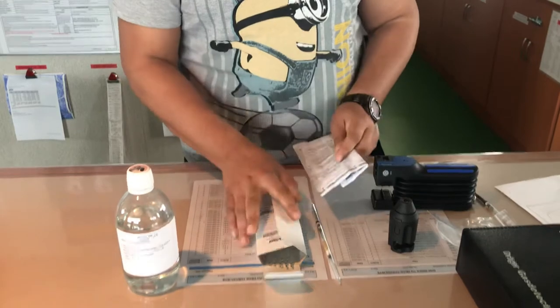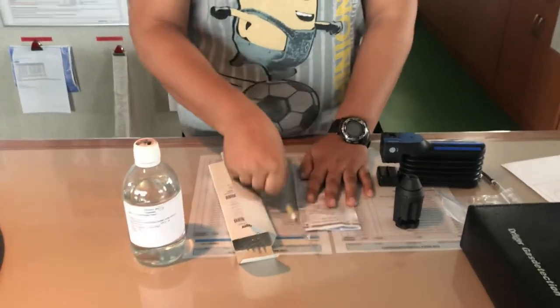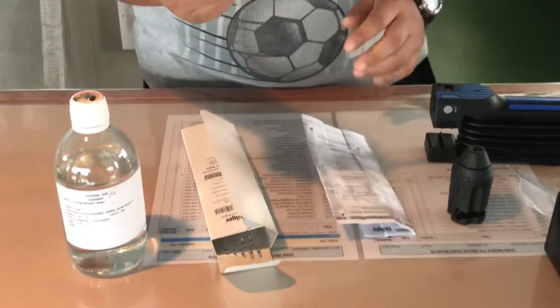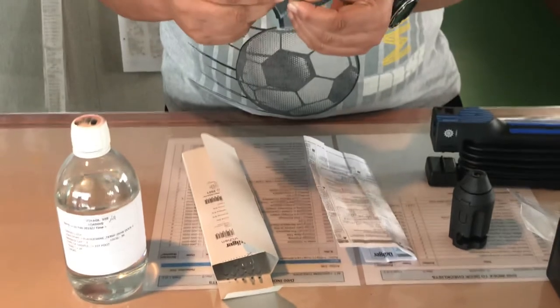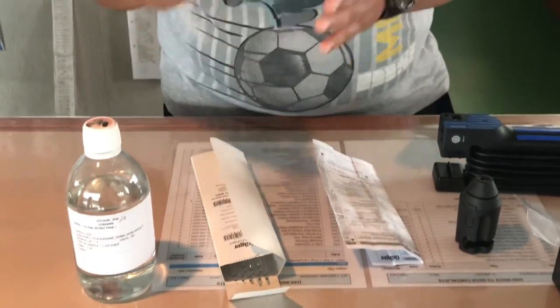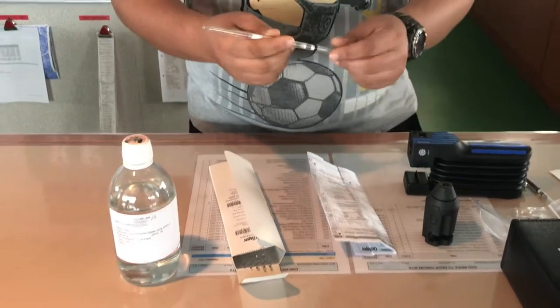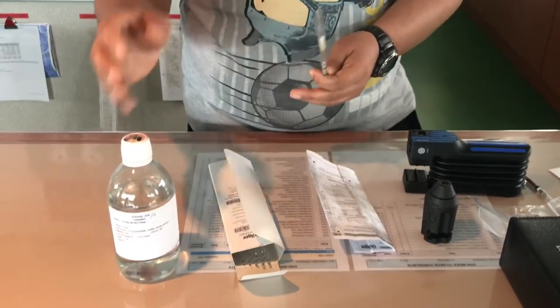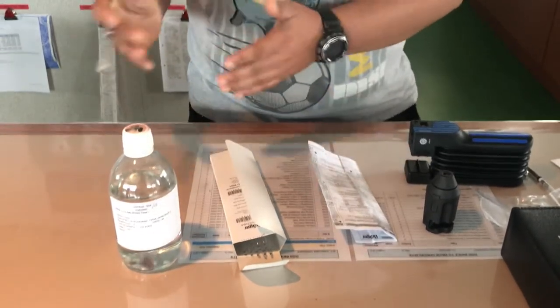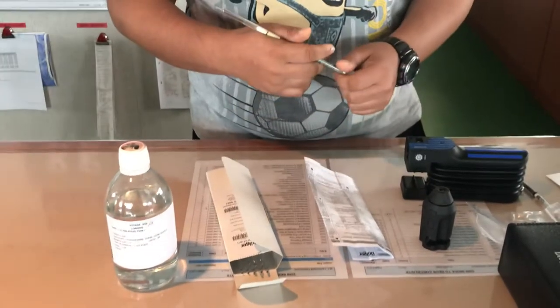The instruction manual tells you the application range and ambient conditions in which the tube must be used. For this tube, the measuring range is 5 ppm to 50 ppm. If EDC vapors are less than 5 ppm, the tube cannot detect it. Since the TLV (threshold limit value) of EDC is 10 ppm, we take 50% of that — so less than 5 ppm is considered safe to work in that environment.